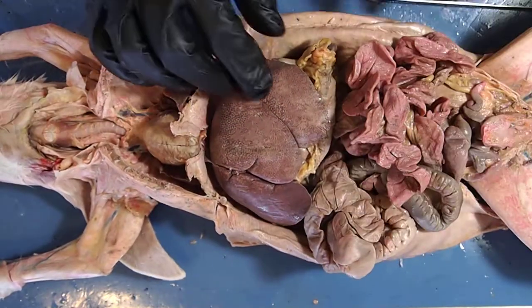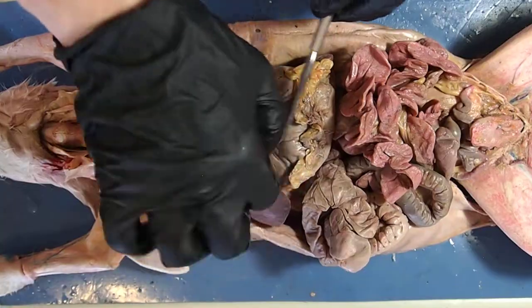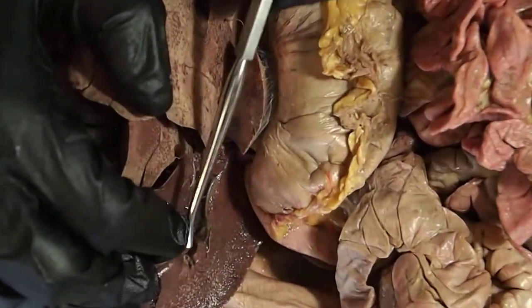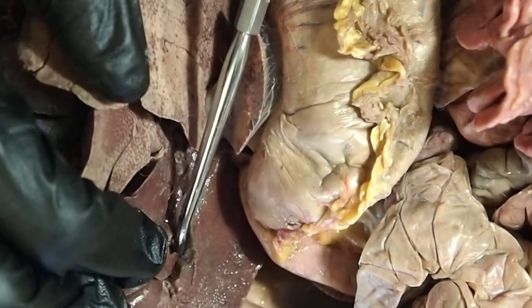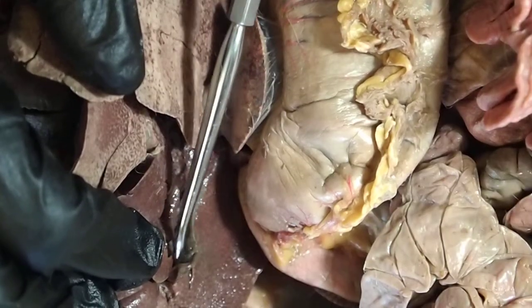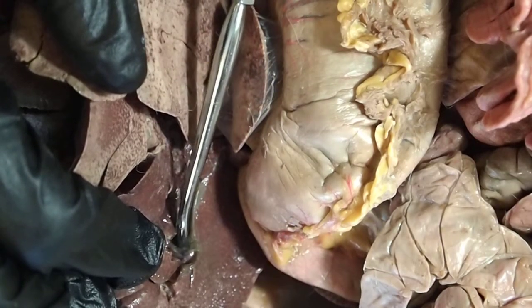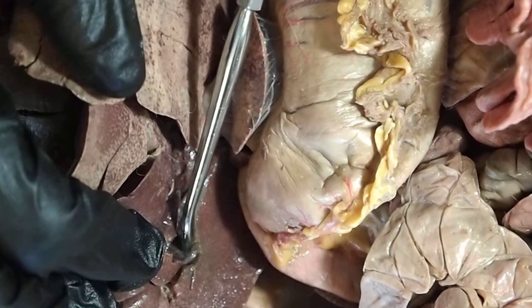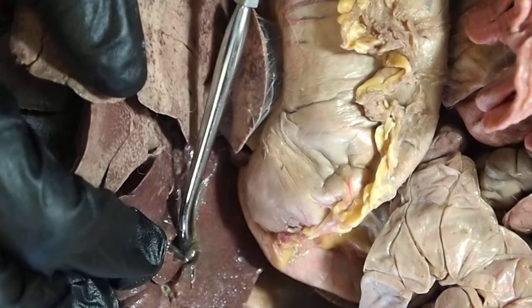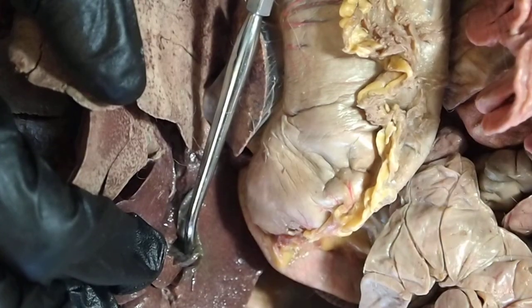Behind the liver I want you to look at this organ. Here's one of the lobes of the liver, and tucked behind it is this little tiny sack — a small pouch with a slight green hue. The green color comes from what this organ does: this is the gallbladder. The gallbladder is an accessory organ in digestion; it stores and releases bile that's involved in the digestive processes.